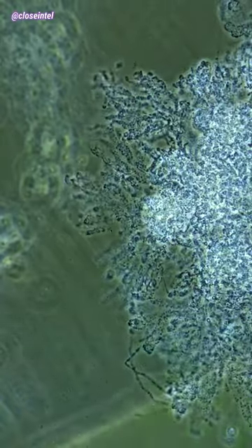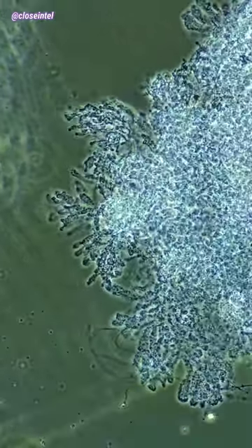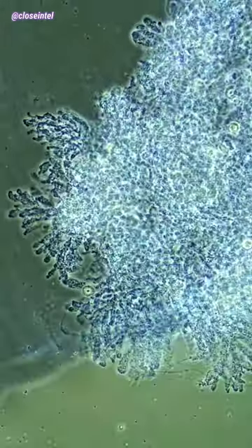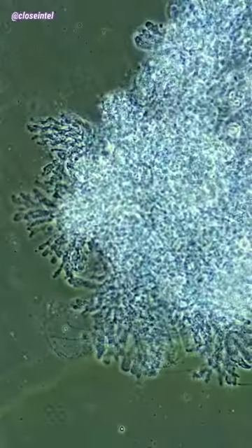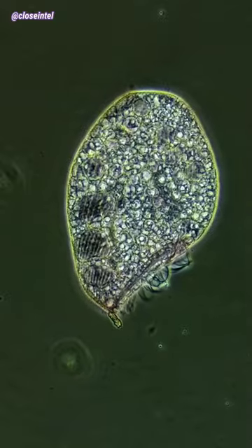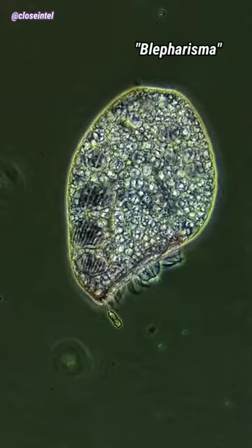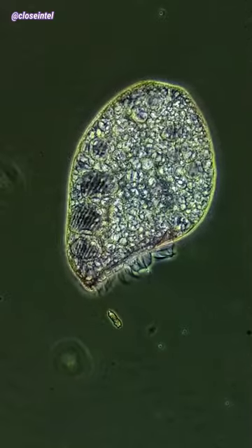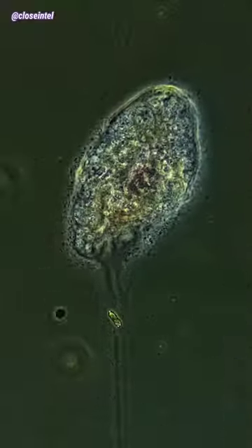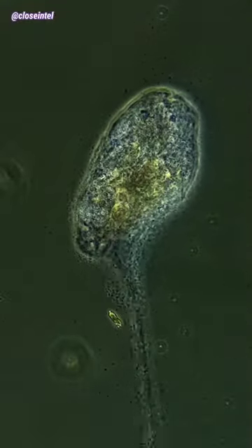This water fungus here compresses into itself and shrivels up once the bleach comes in contact with it. I then tested it on an organism called a blepharisma, and once it comes in contact, the cell wall ruptures and the cell slowly starts to melt away.